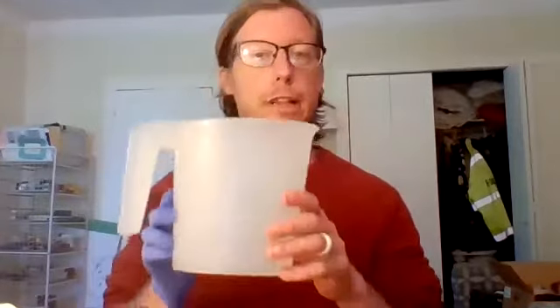I'm using Epsom salt. It's cheap, it's innocuous, and I have heard through the past that the official concentrations that they use to make this flotation solution, like the stuff you buy, can actually lyse the cells and the eggs and blow them up, so they're not good to count. So my point is, Epsom salts or regular salts are a really great thing to use. They're cheap, they're everywhere, and they'll do what you need to get done.